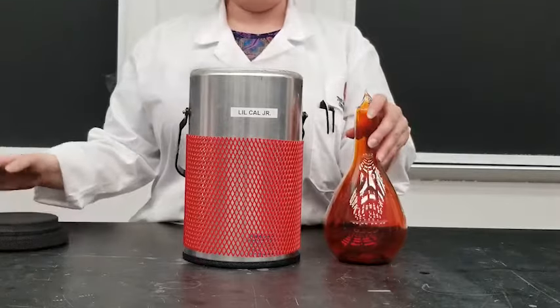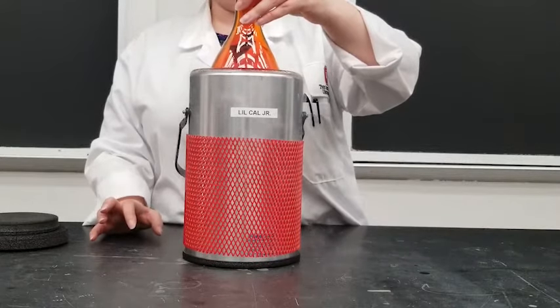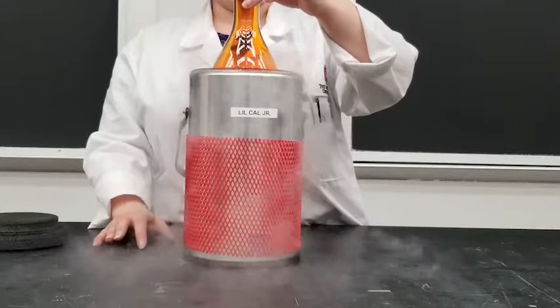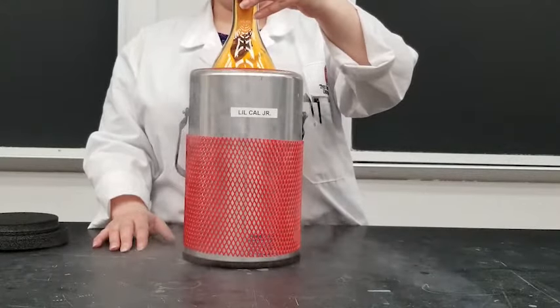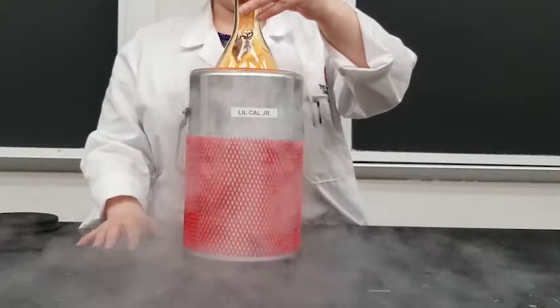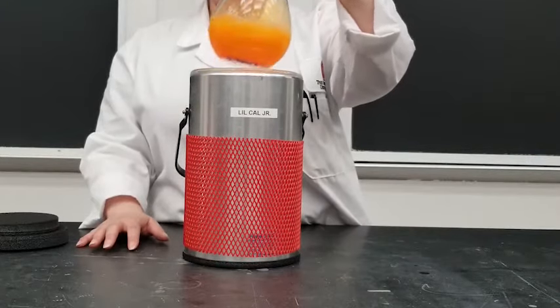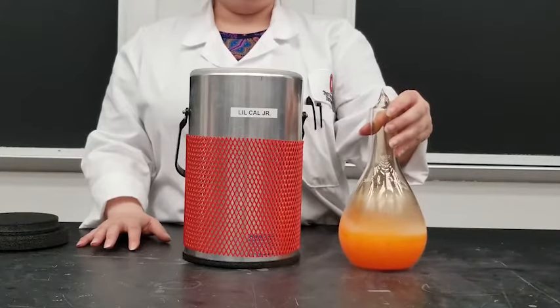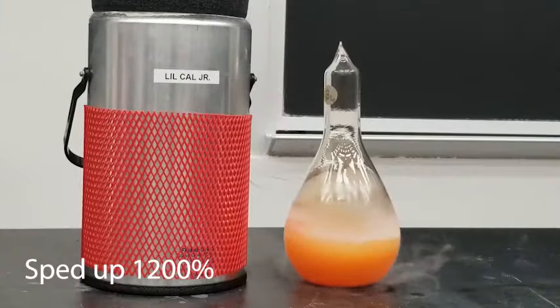Let's do something fun with the bromine. I can submerge this in liquid nitrogen and freeze the bromine. You can see the color in the glass getting paler and paler. Now I've frozen the bromine. If I let it sit, it will warm up and melt and then re-boil. Let's do it.